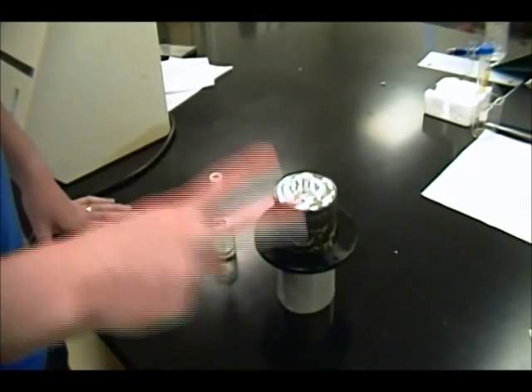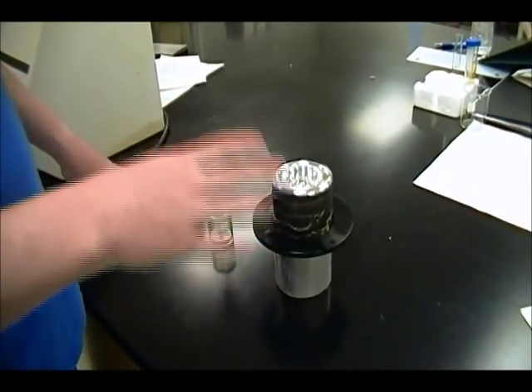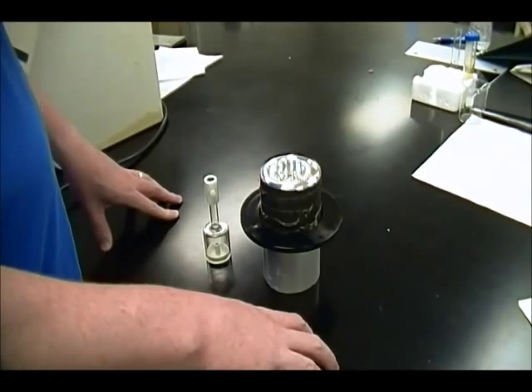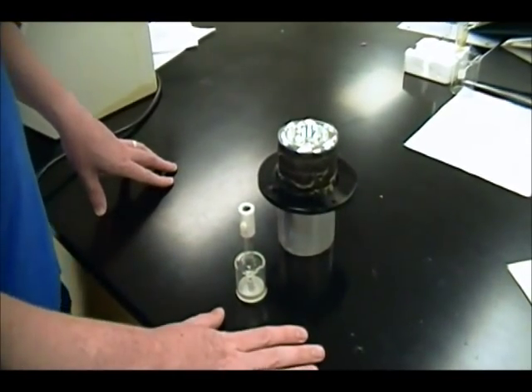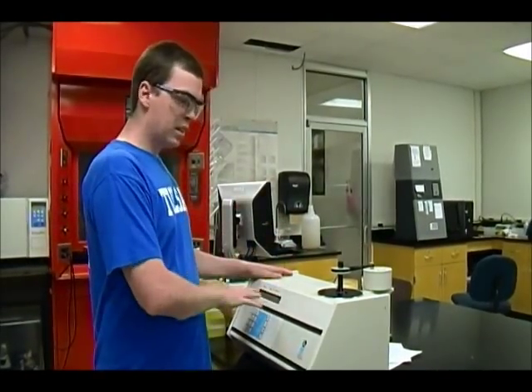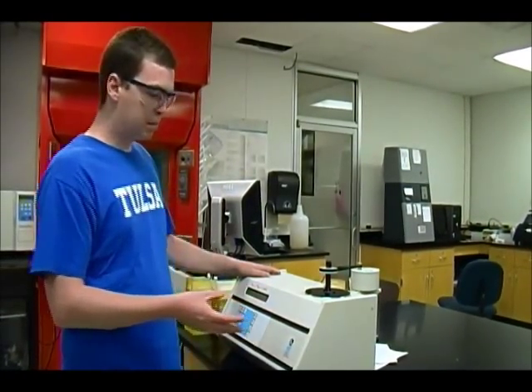After you finish the calibration, you'll be doing two different unknowns. The first unknown is going to be potassium nitrate. Before you start measuring or weighing, once again make sure everything is clean and dry. After that, you'll pipette 100 milliliters of distilled water into your Dewar, and you'll weigh out 0.4 to 0.45 grams of potassium nitrate into the Teflon dish. Once measured out, you put the system together just like you did for the calibration. You'll put in the codes — they'll be slightly different this time, so pay attention to your procedure. You'll bop the top when it beeps to release the compound, and when it beeps again your system is finished and you can get your data.